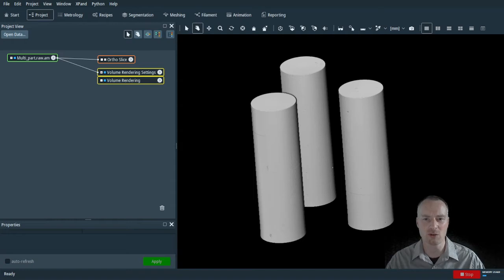In X-ray computed tomography, it's standard practice to scan one item at a time and then analyse the data. In this example, we're going to show you how to analyse multiple specimens from a single scan. This is far more efficient time-wise, but it is not straightforward.